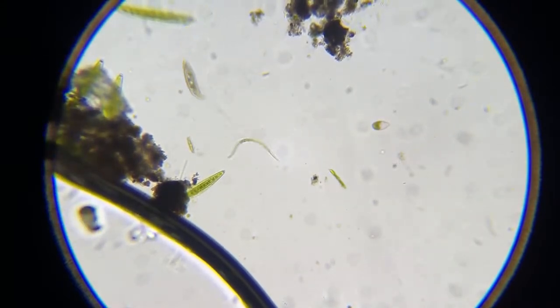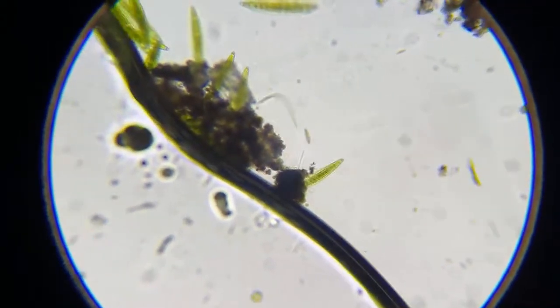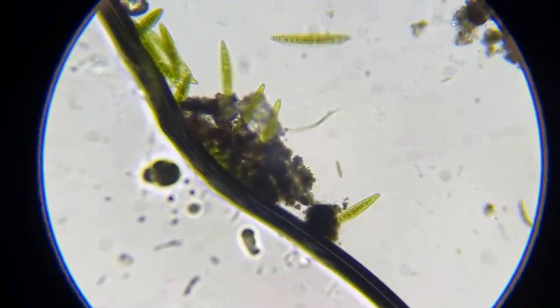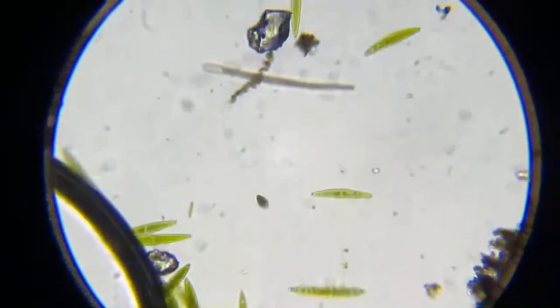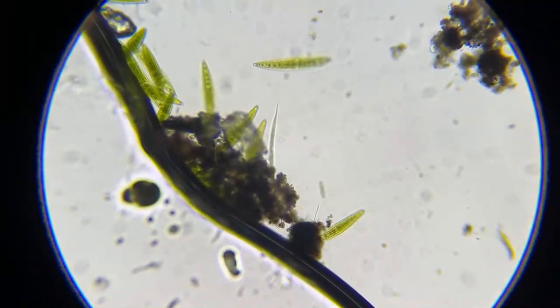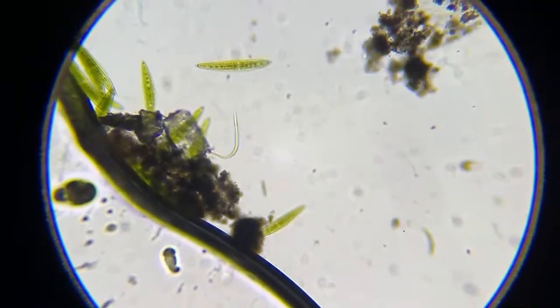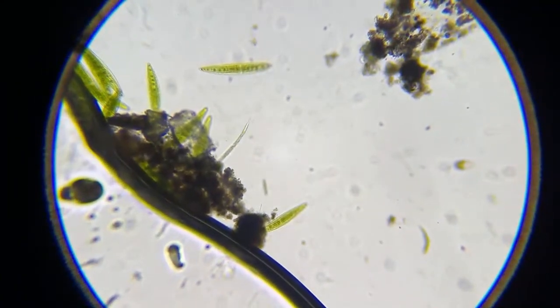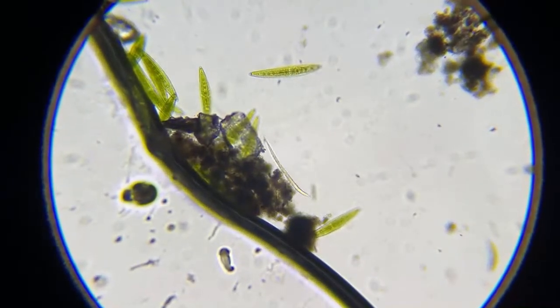Their larvae make their way through your intestines, and they grow into these worms, and they lay eggs in your intestines, and then you poop them out, and then the next poor guy that comes around and steps in your poop gets the larva, and they repeat over and over and over. So this guy you don't want to have inside of you.